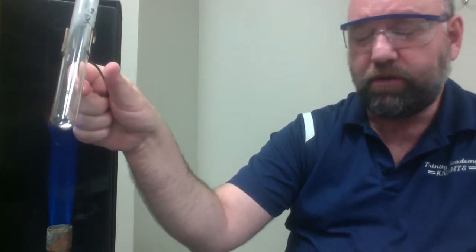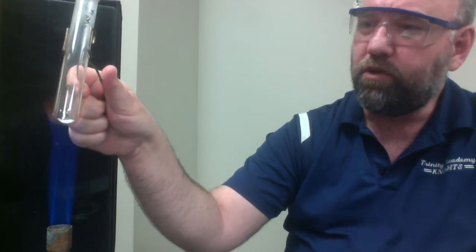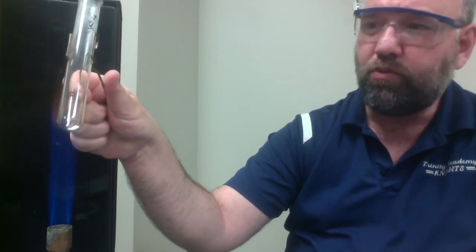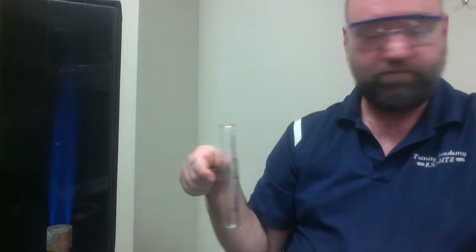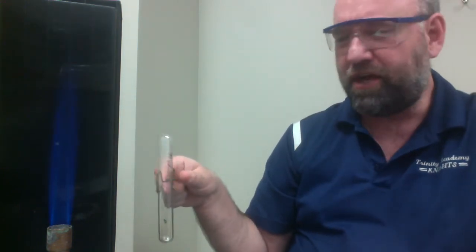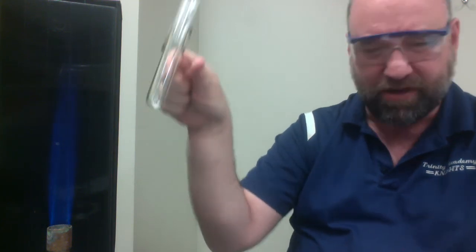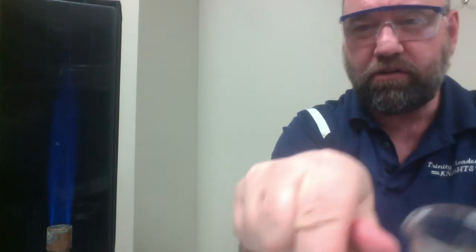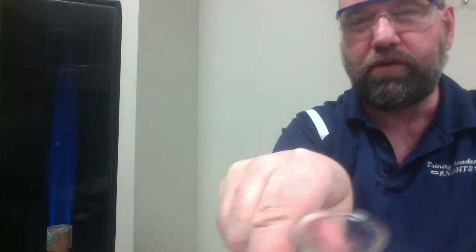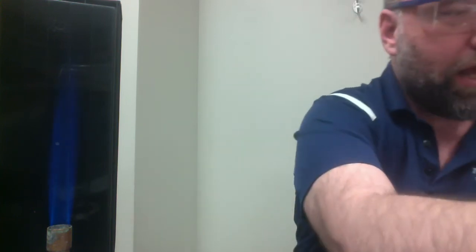One thing I tell every group that ever does this one is you won't have to wonder if you smell it, you will know it. So if I waft again, there, I definitely smelled it. Well, yeah, there's no mistaking it. You can see if you can smell it through the computer. If you can, please let me know, because that's some sort of cool powers I'm not aware of.